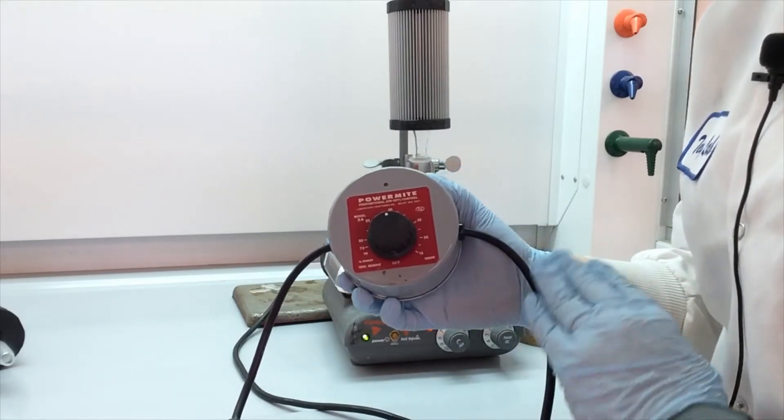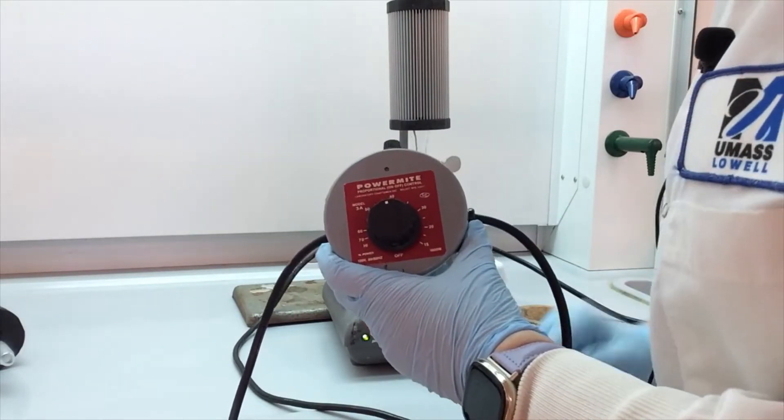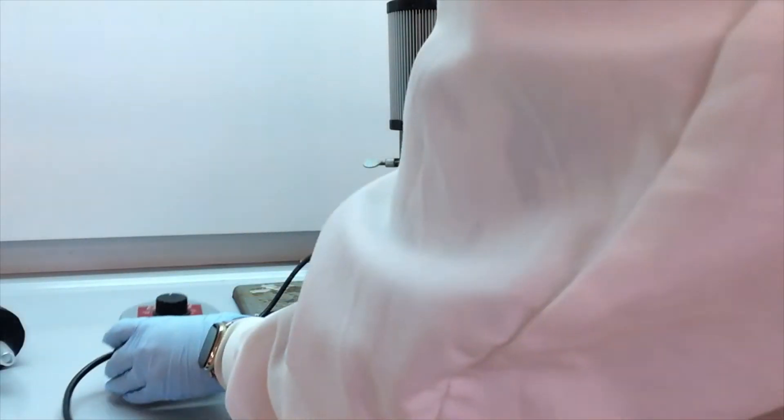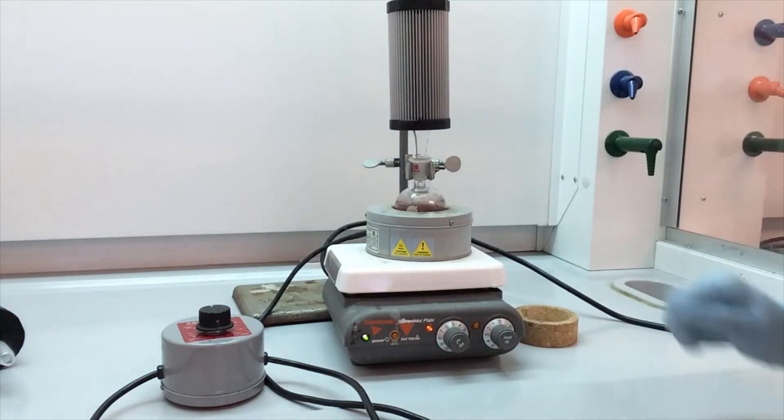That's normal. Just because it turns off doesn't mean it's broken. If it never turns on, that's a problem.